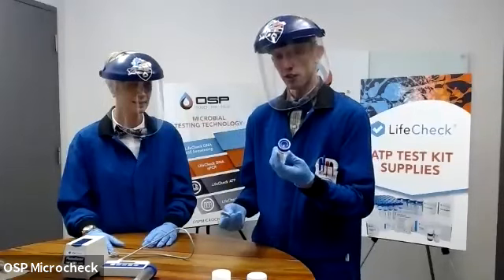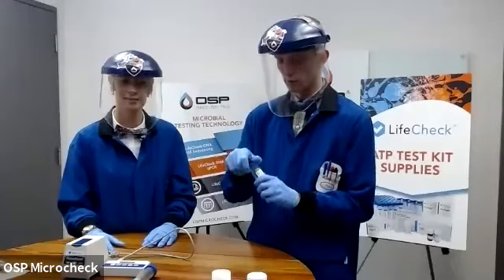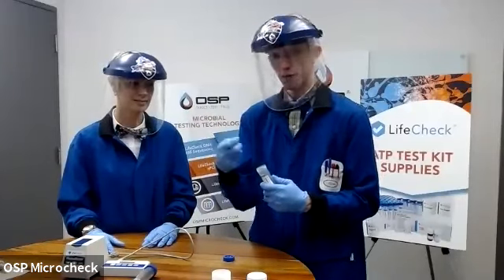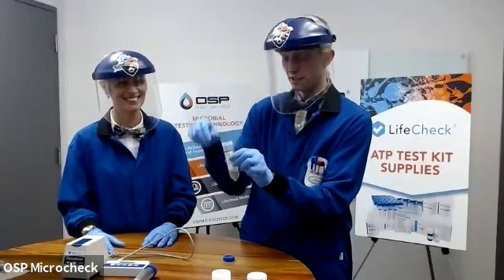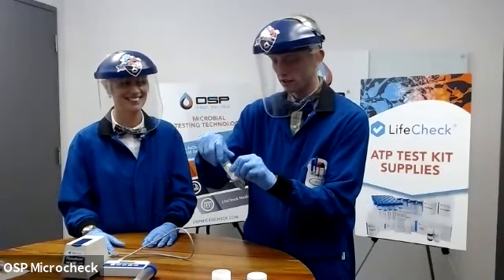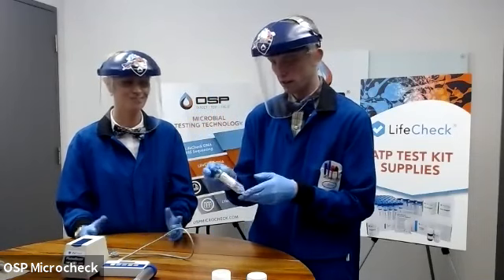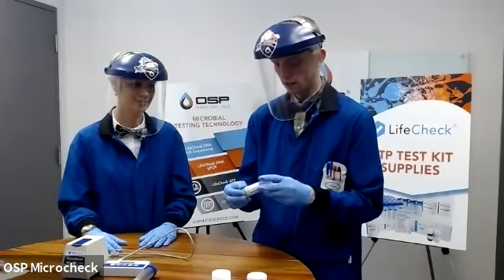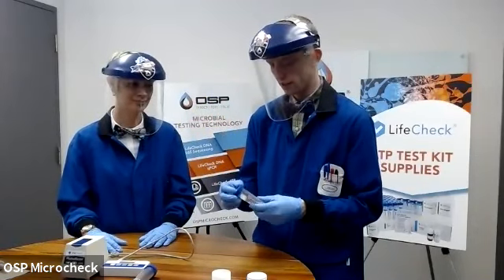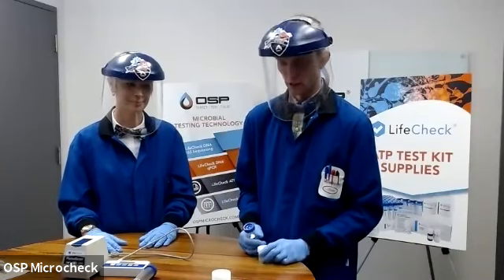The other place this is commonly used is in coupon assessments. So imagine, if you will, this bolt is my coupon. Obviously, I don't want to be manhandling it quite like this, but the idea is that you would simply place your coupon with your biofilm on it, or your sessile microbial community, into that tube, rock it around for 10 minutes, exposing all of that nice sessile microbial community to the lysis agent, and once more conducting your ATP test using the luminometer at this point.